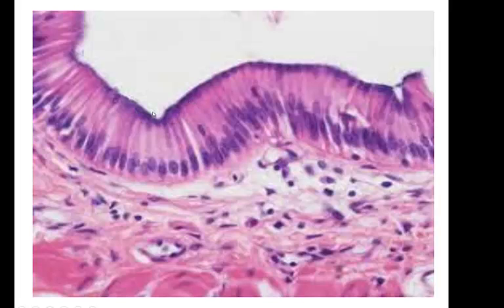And so when you get all these little folds in the plasma membrane to increase absorptive area, it really takes up the dye very well, and so it stains darkly up here. So these are microvilli on the edges of our columnar cells. Now you see all this stuff down here? This is areolar connective tissue.